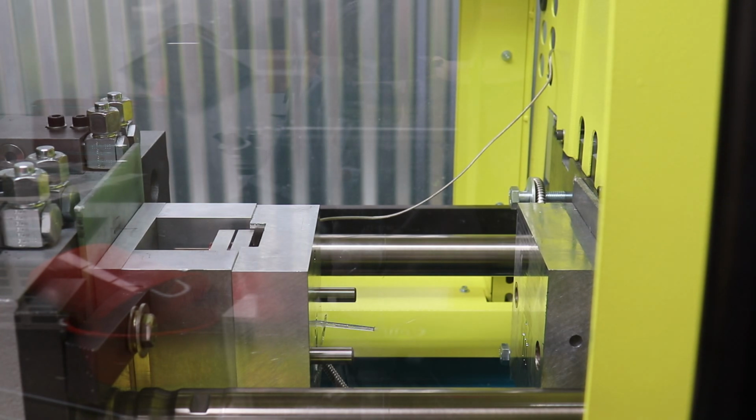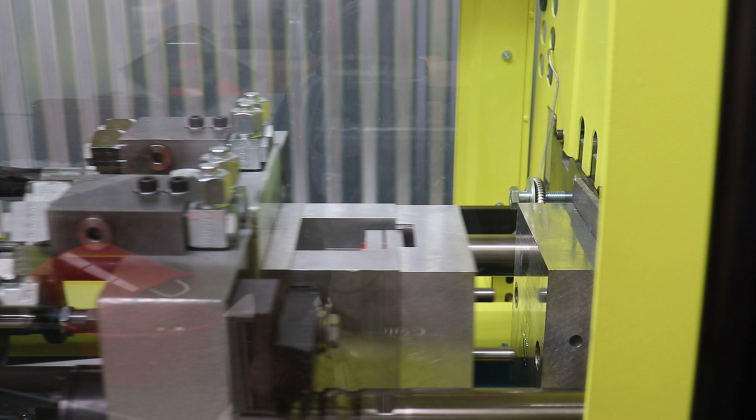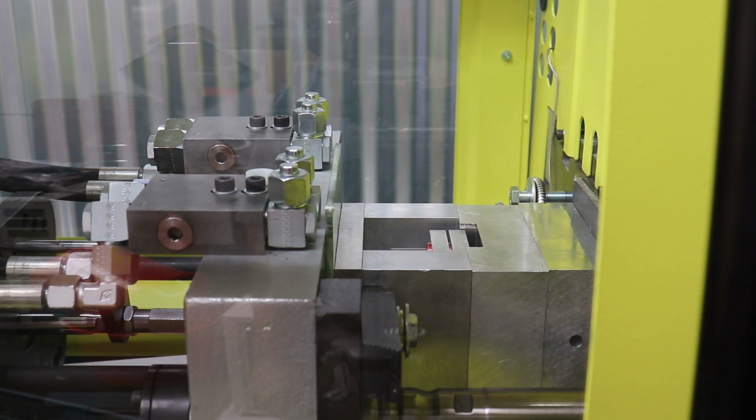Yeah, our sprue puller is holding and ejecting, and then we go and do the next shot. Well, there you have it.